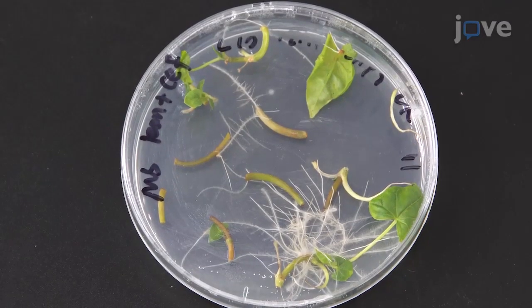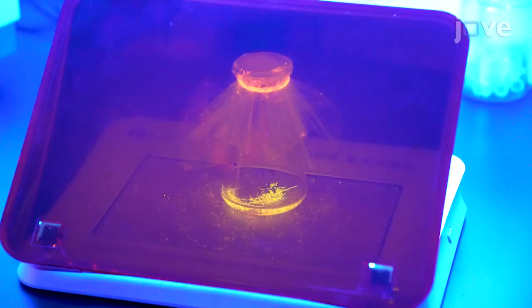Although this method is easy to perform, it has many detailed steps. Visual demonstration can help researchers achieve a more efficient hairy roots induction.